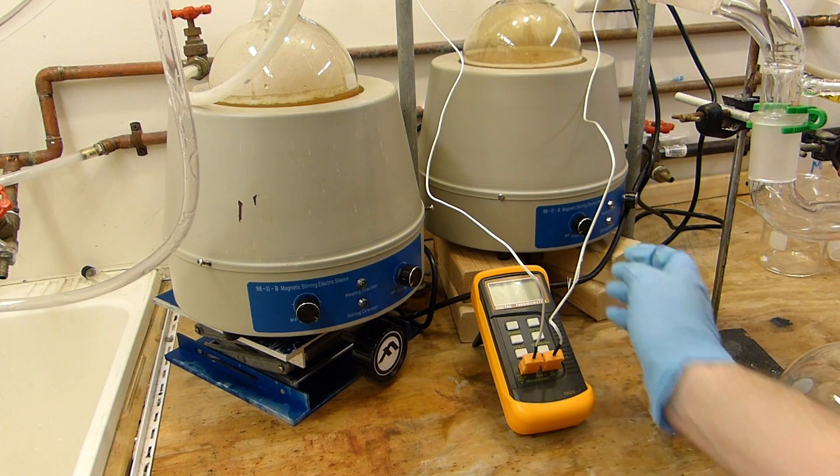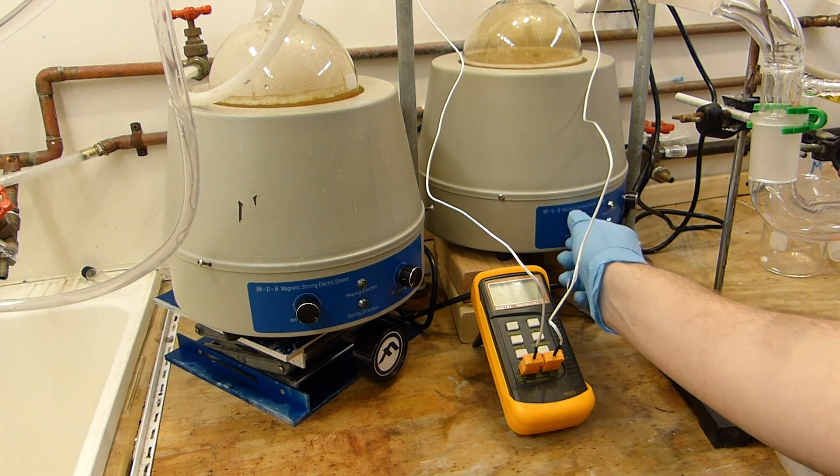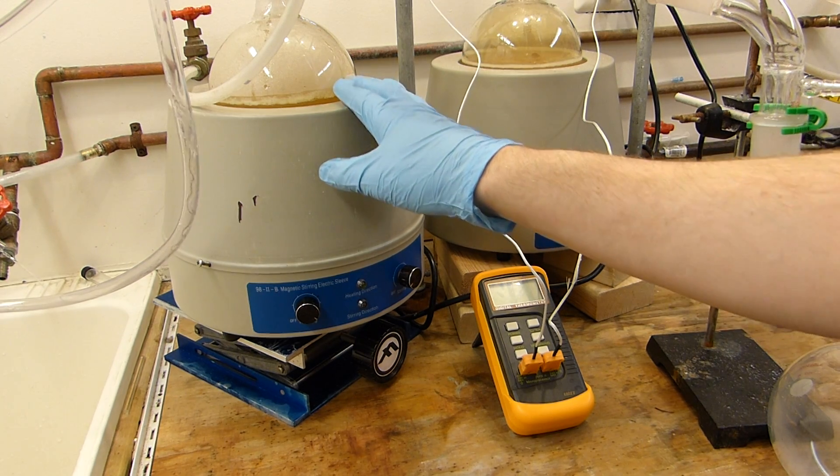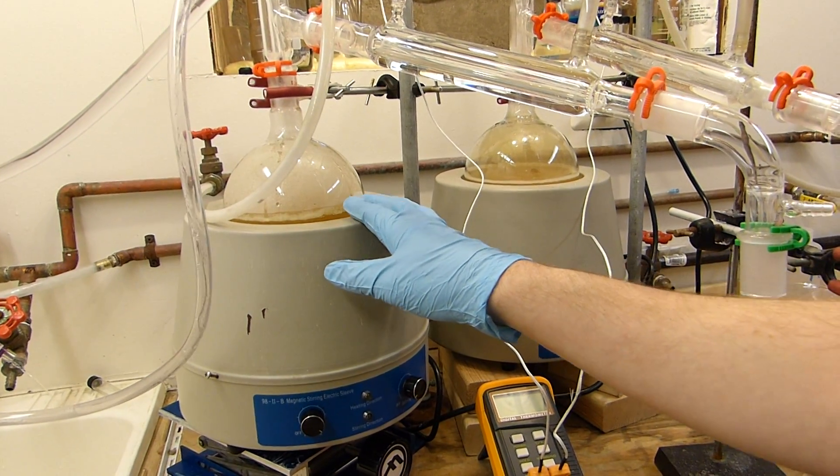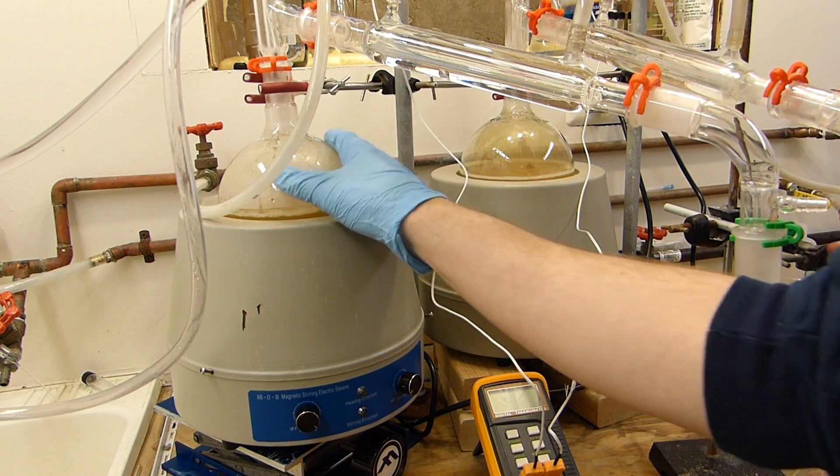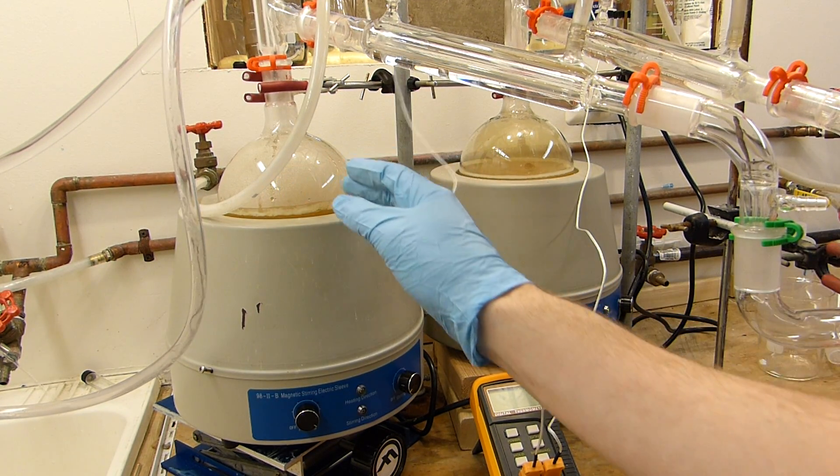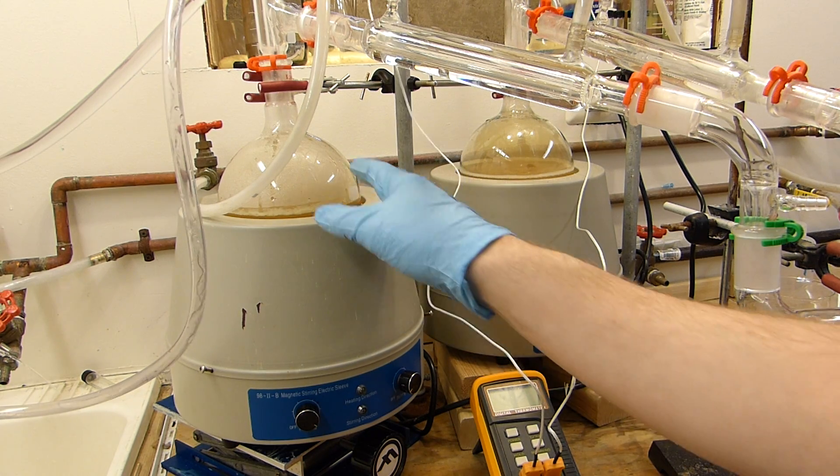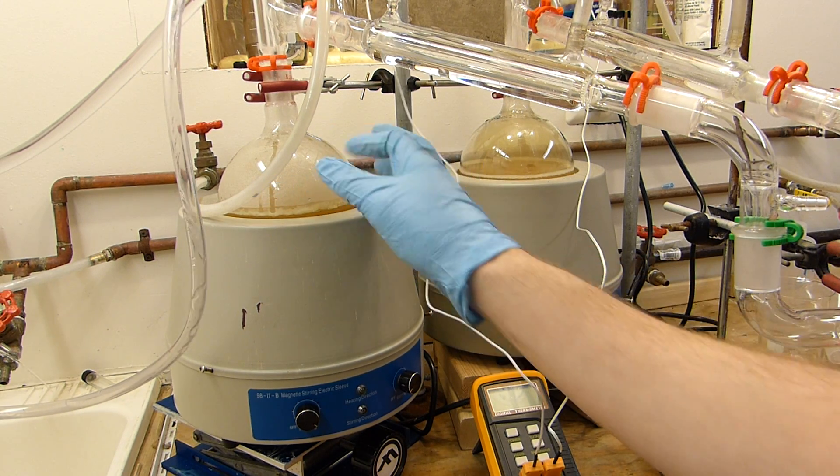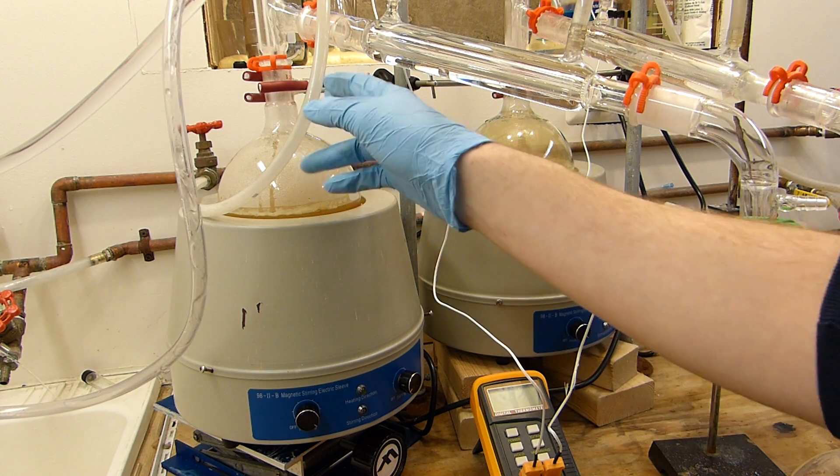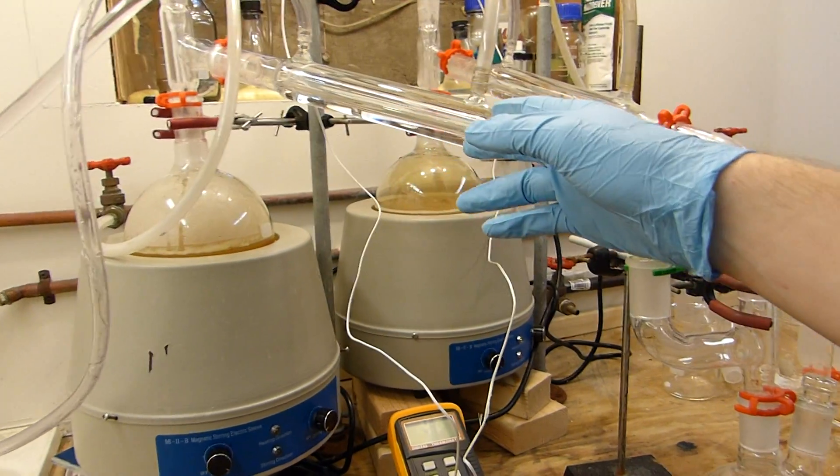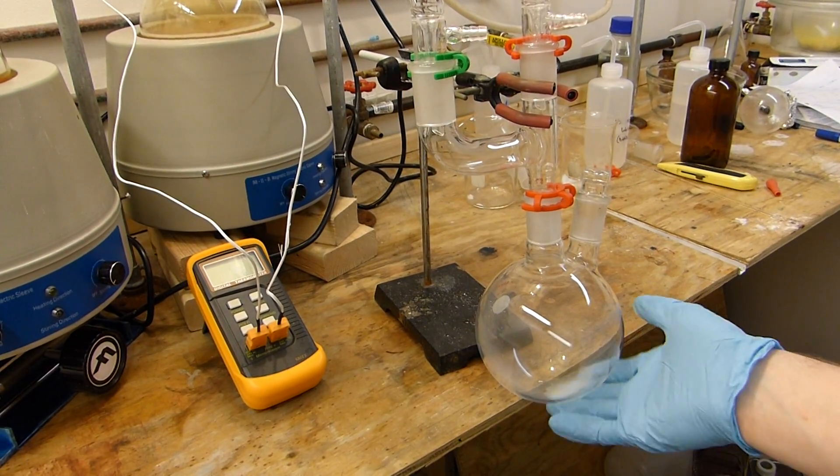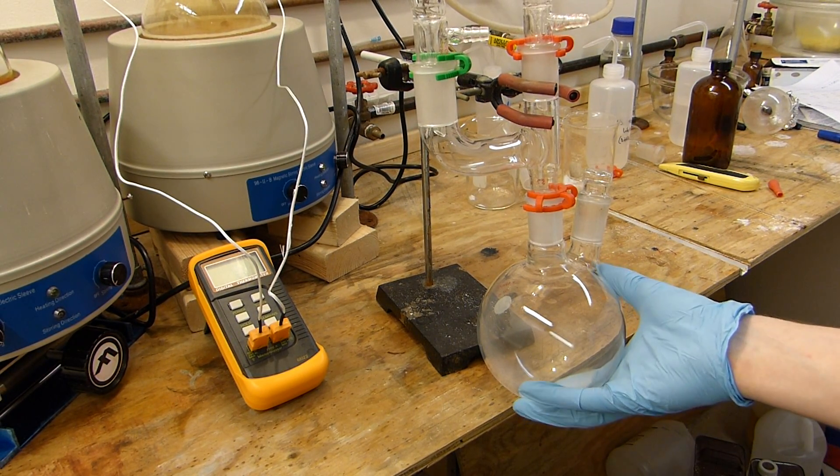Both stills are now turned on to heat at maximum, which will bring the contents of these reaction flasks to a boil. Now, these flasks, if you remember, have an equilibrium set up between sulfuric acid, nitric acid, potassium bisulfate, and potassium nitrate. And as they boil, the most volatile component will come off first, in that case nitric acid, which will drive the reaction to completion. The nitric acid that boils out will travel through the still head, and into these condensers, where it will condense to a liquid, and drip down into this collection flask here, where we'll collect the crude nitric acid for further processing.